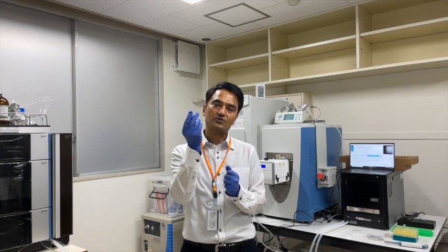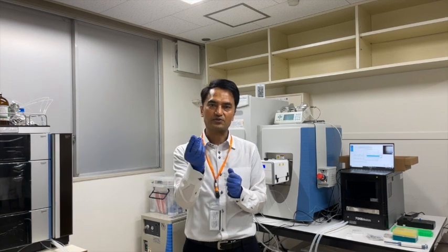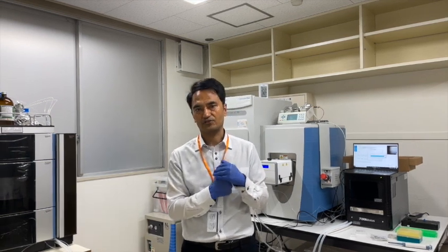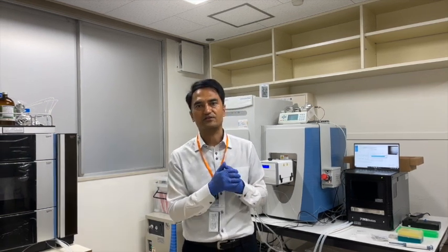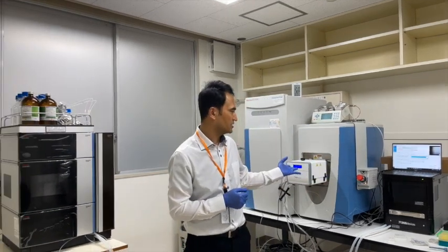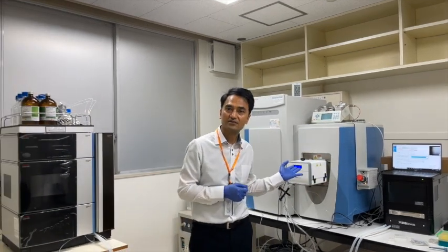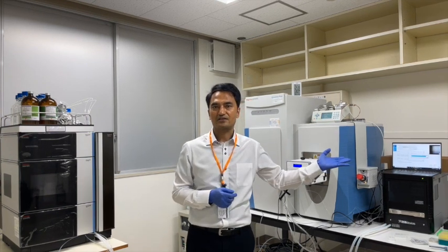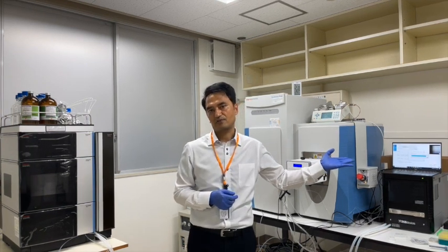From those plasma samples we extract the metabolites. This is our standard protocol. And those metabolites we are now trying to detect with that mass spectrometer.